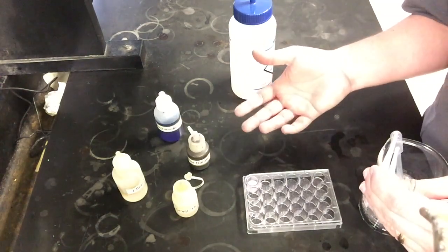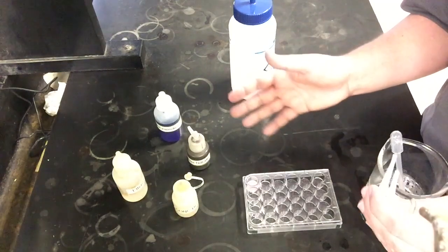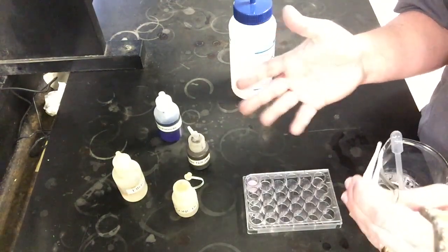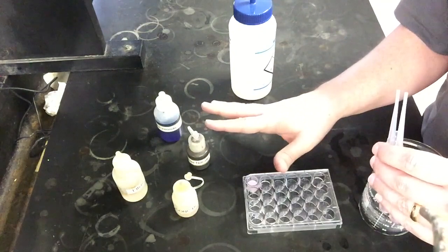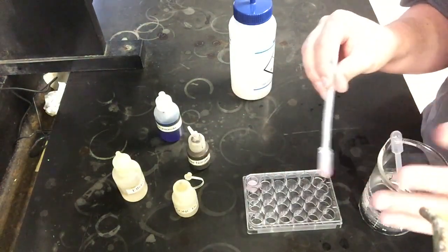Long term, it's not super harmful. The color will go away after a couple days, but if you ever work with silver nitrate in the future and notice you have black splotches on your hand, that should be a tip-off: oh, I got silver nitrate on my hands. Like I said, you might not see it right away, but it's something to think about in the future if you ever have to handle it, because I'm pretty sure anyone going into organic will probably see this reagent again. So it's just something to keep in mind.